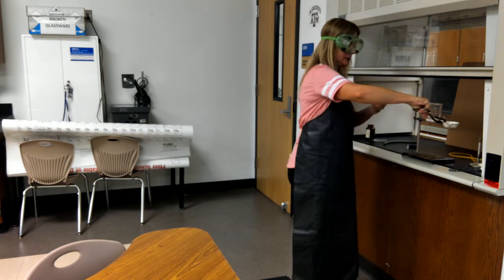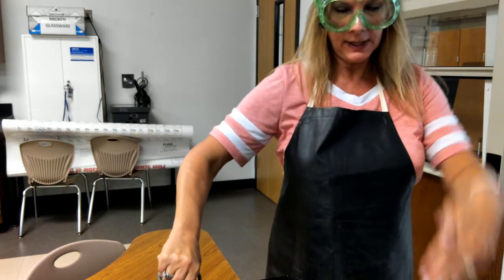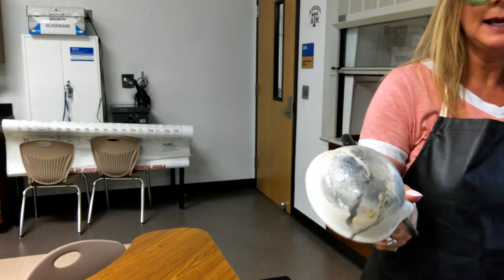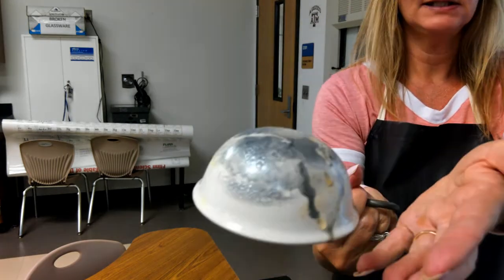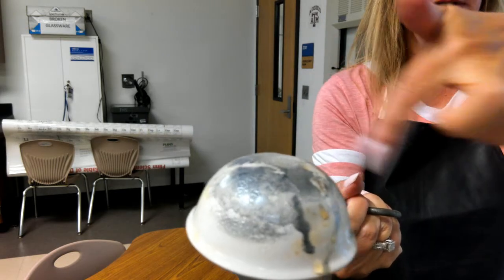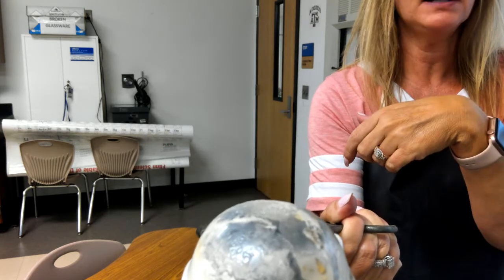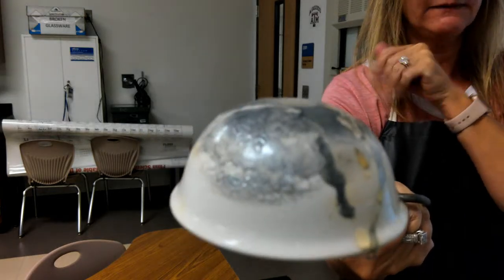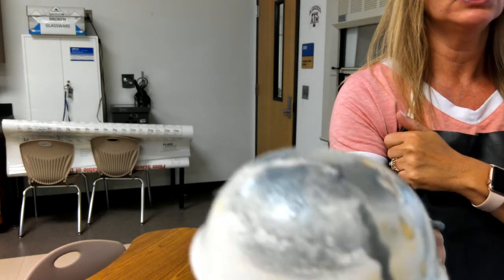Okay, so now I'm going to dump out the ice that was on top. So remember, I heated it from the bottom and I had ice on the top to cool it back down. And then you can see what's left. Hopefully I won't drop this. We're back to the gray. I should have showed you what it looked like before, but there was none of this gray stuff on the bottom of it. It was clean. But those gray little flecks are the iodine, so it returned back to its original state.